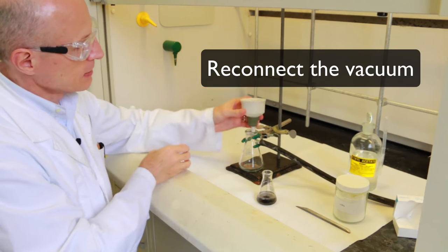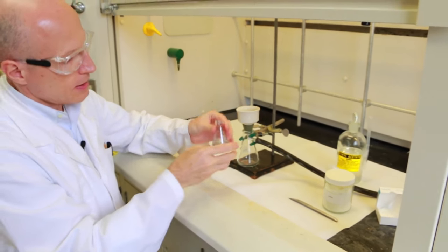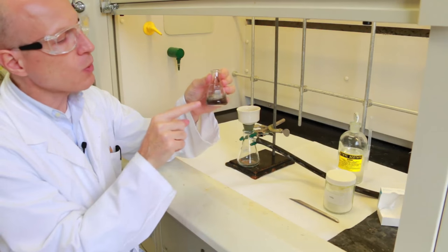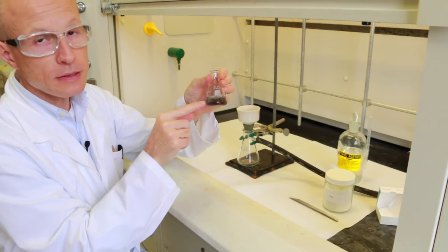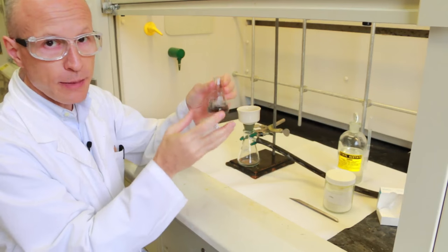You can put the funnel back. In this case you want the filtrate, that is the liquid. You just want to get rid of the solid that will become waste.